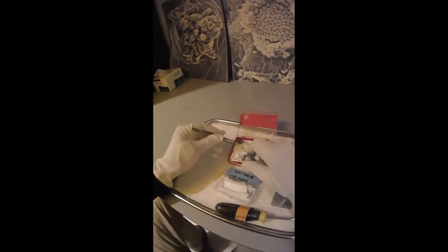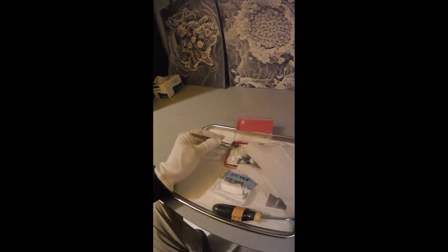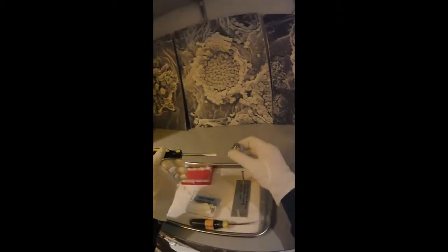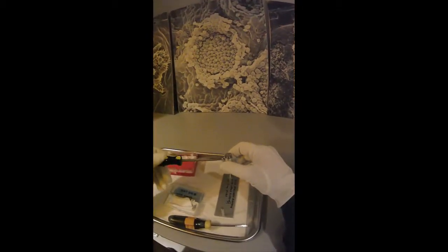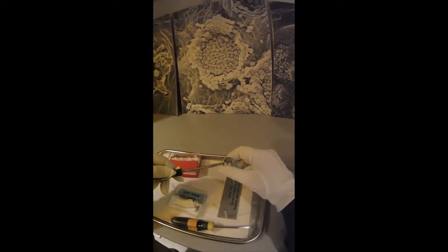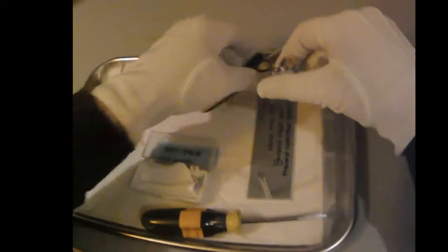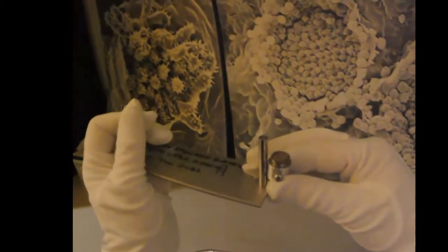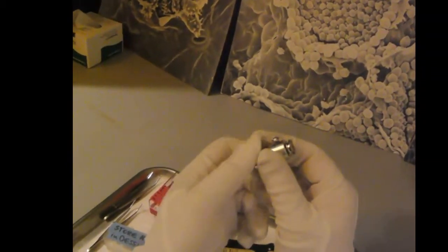So we take our sample out of the sample tray, place it in the holder, use the small screwdriver to lock the set screw and you want to make sure that it's the right height. So we have a height check here. The sample should be at the top mark, not the bottom mark. So we need to adjust this by unlocking these bottom nuts here.